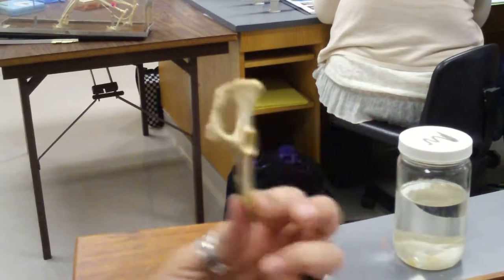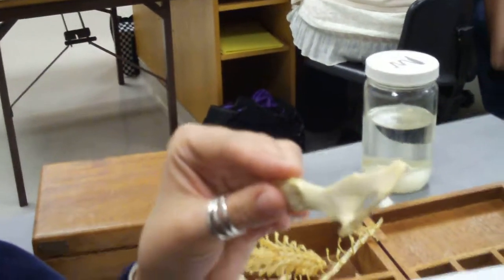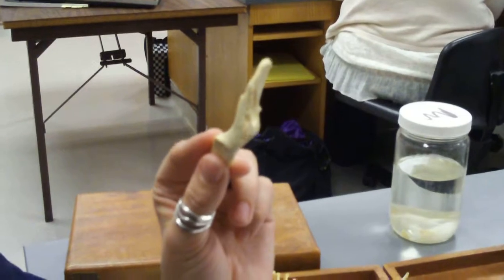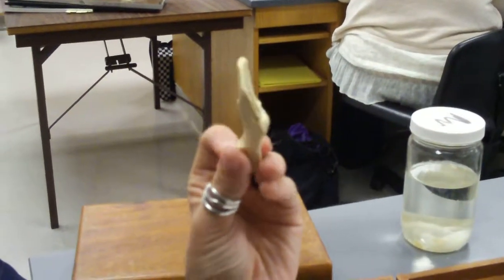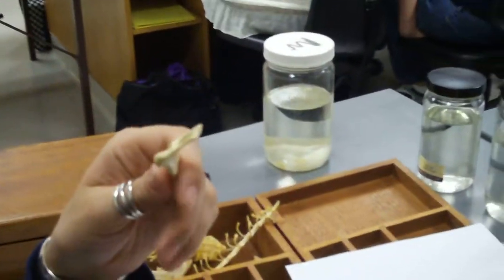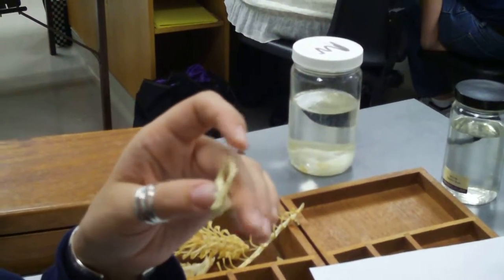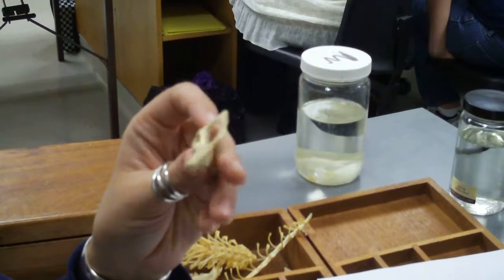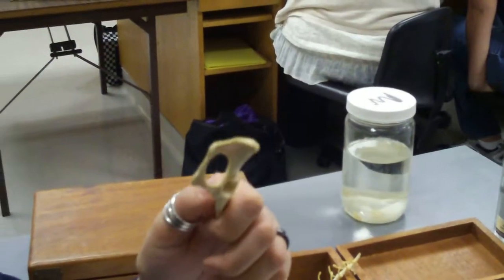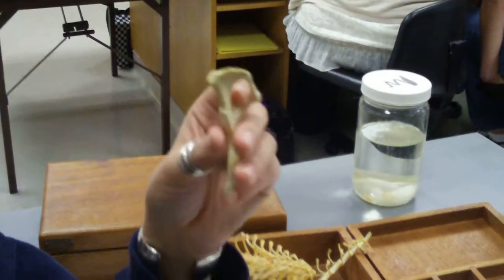In development, it's three bones that fuse together. You have the ilium, the ischium, or ischium, if you've ever taken Dr. Bray's class and he corrects you five bajillion times on how to pronounce it. Maybe he's gotten lax. Is he gone? He was on his way out when I was there. He was really frustrated. He had too many cheaters in his class. I don't understand why you would try and cheat in his class, because he does all the same stuff that I make you guys do. Roll up your sleeves, turn your hats off. Anyway. So ilium, ischium, and pubis.